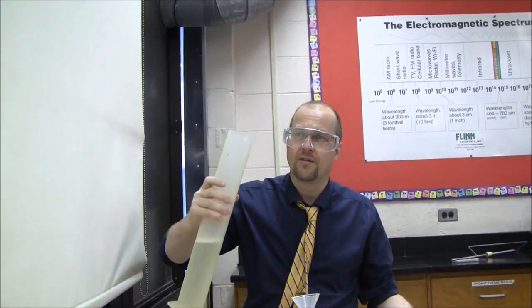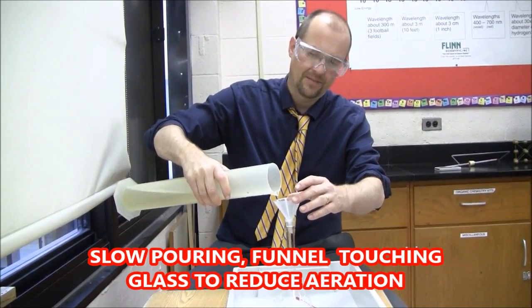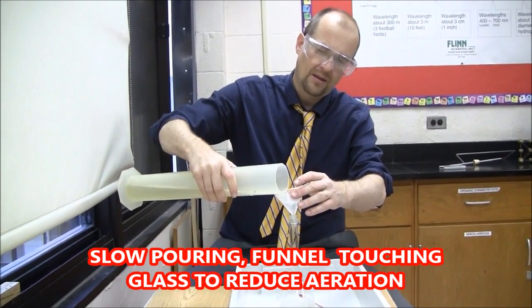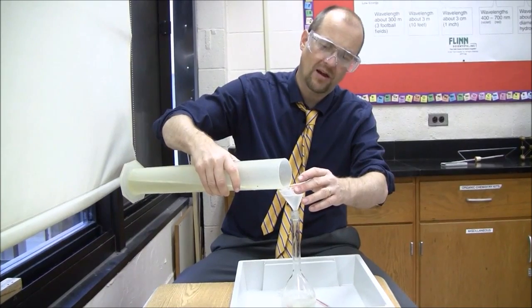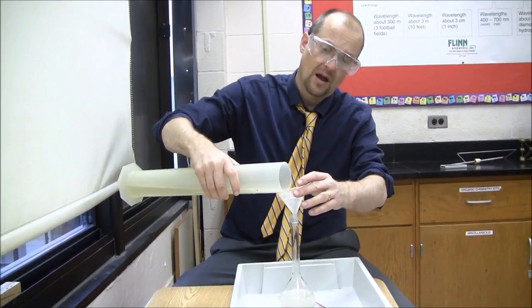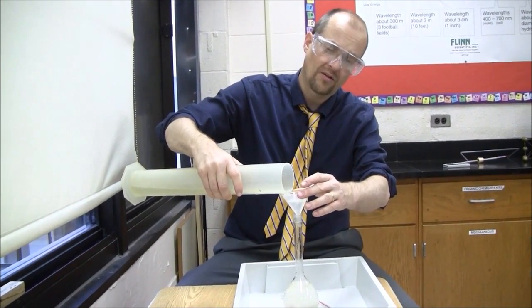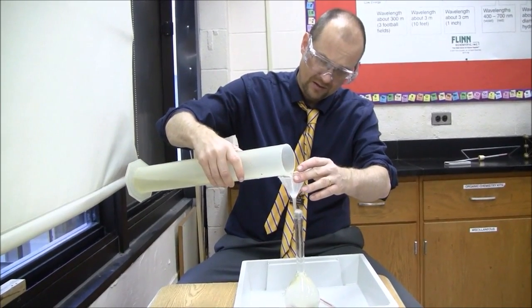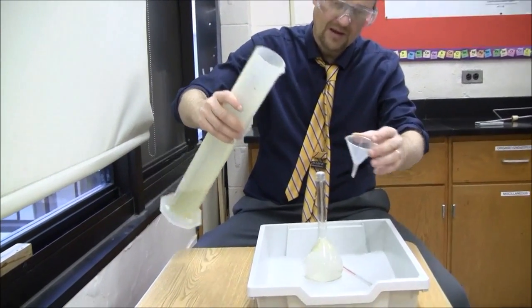This is water from the East River of New York. I'm going to put it into this container. You need to have a known volume of water. This is a 250 milliliter volumetric flask, but I'm actually going to fill it up completely — slightly more than 250, which I'll work out later. I don't want to leave any air in the flask, because then I'd be measuring oxygen from the air as well as the water.